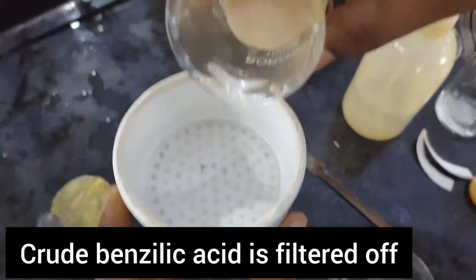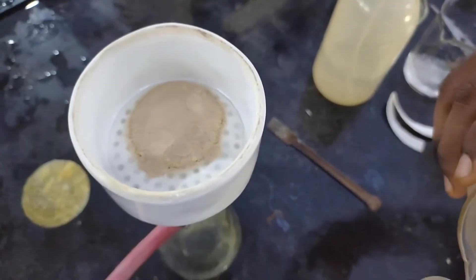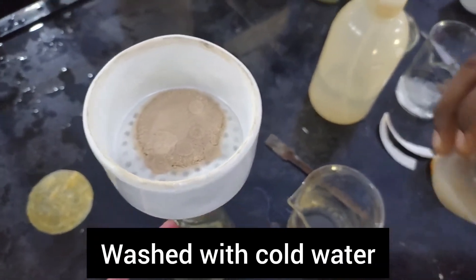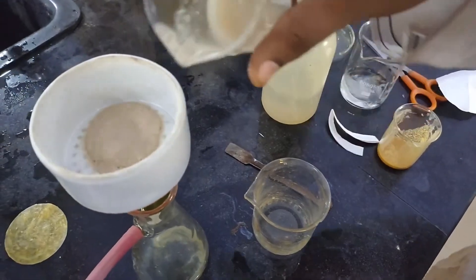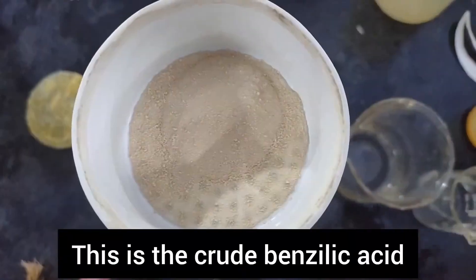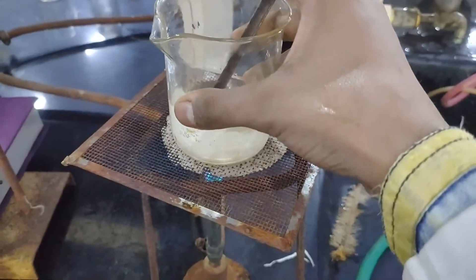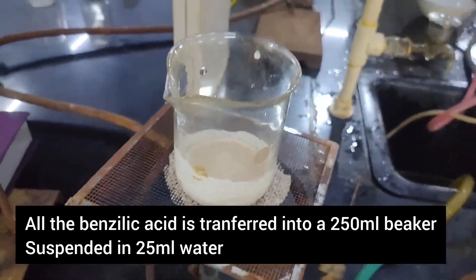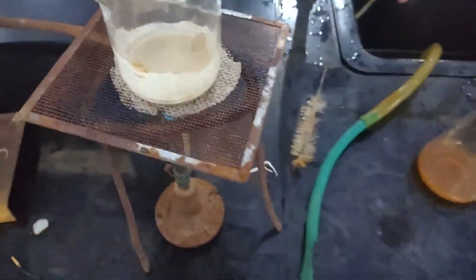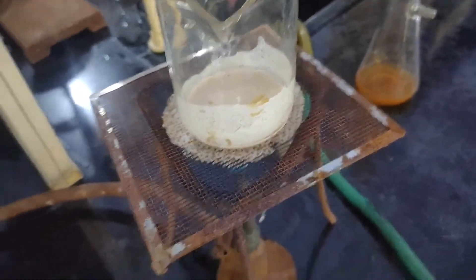The crude benzilic acid was filtered off using a Buchner funnel and the beaker was washed with cold water. The crude benzilic acid was then transferred into a 250 ml beaker, suspended in 25 ml of distilled water, and heated.